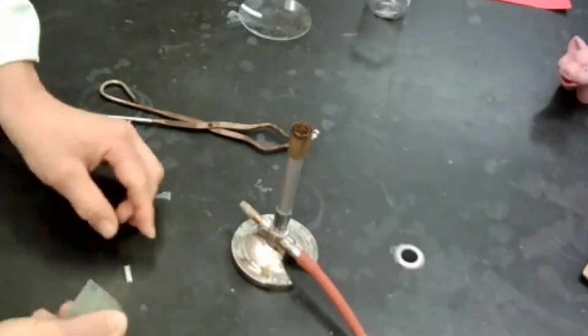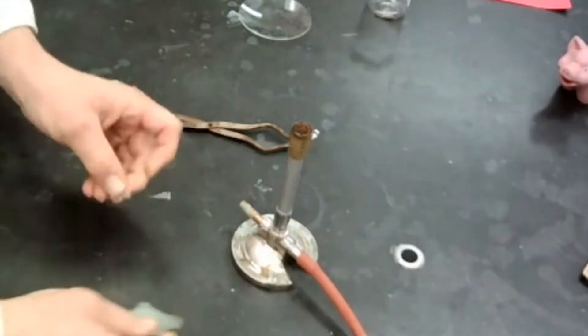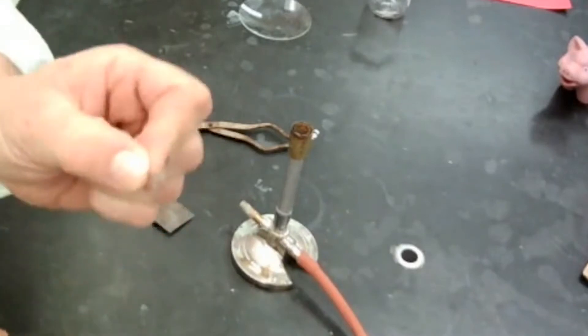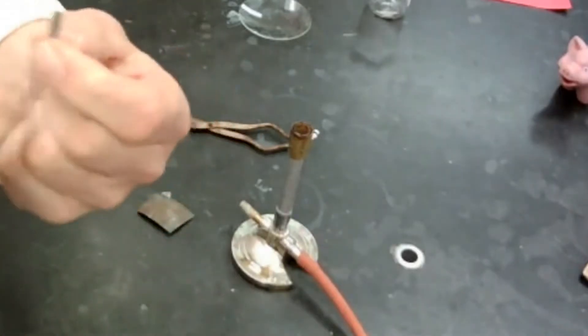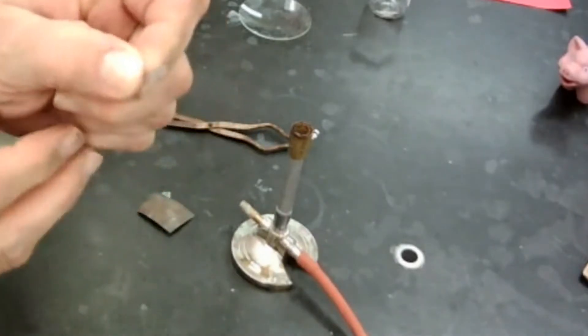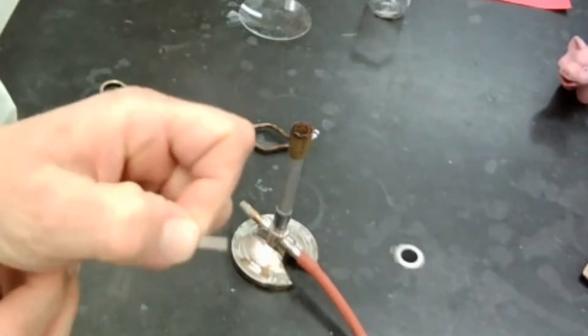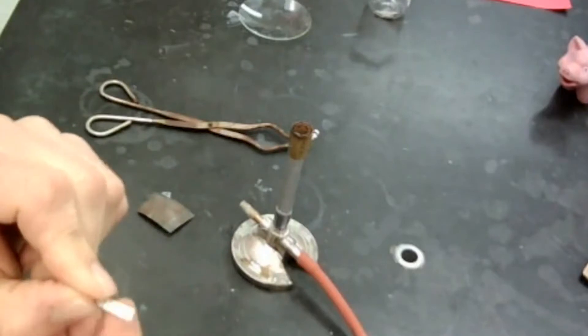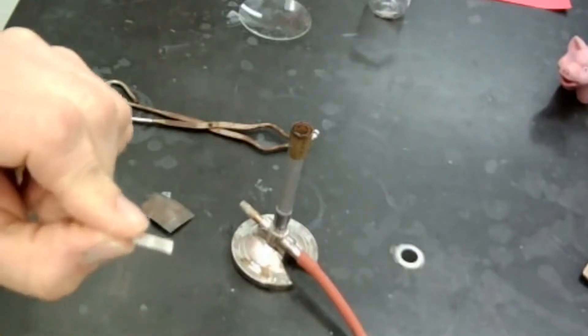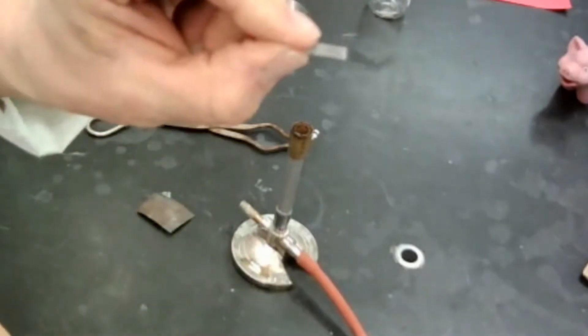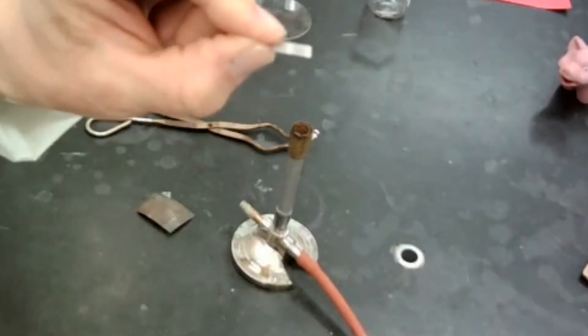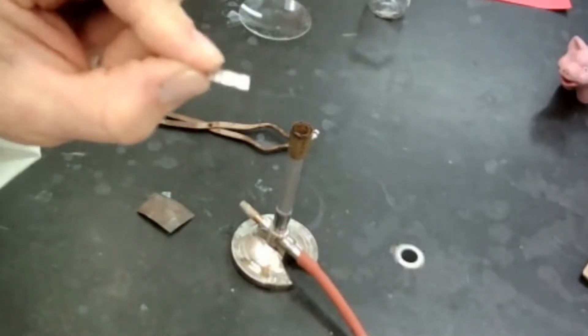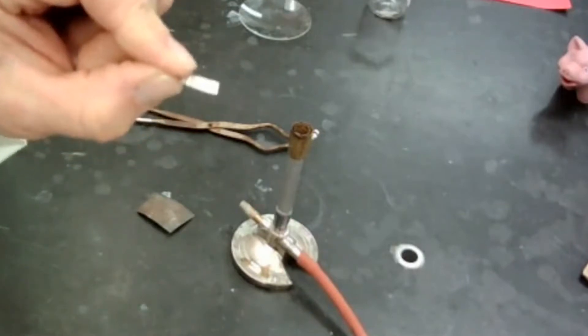And then magnesium is a little bit more reactive than iron, so it's going to happen a little more quickly. Silver does the same thing. We call that tarnish, and you guys can see I probably got a little bit on my hand here, but this magnesium is a little bit shiny now. And my fingers are definitely dirty from the oxides that are on the outside. This is my magnesium. So let's go through observations and I want you to take them in a very specific way.